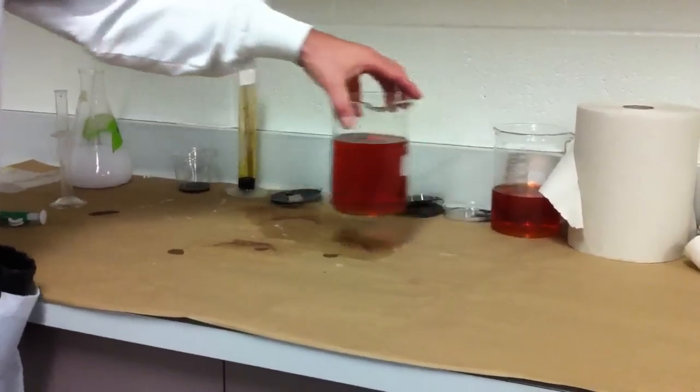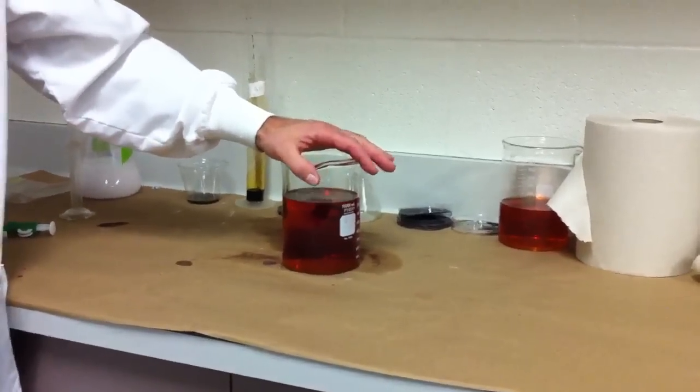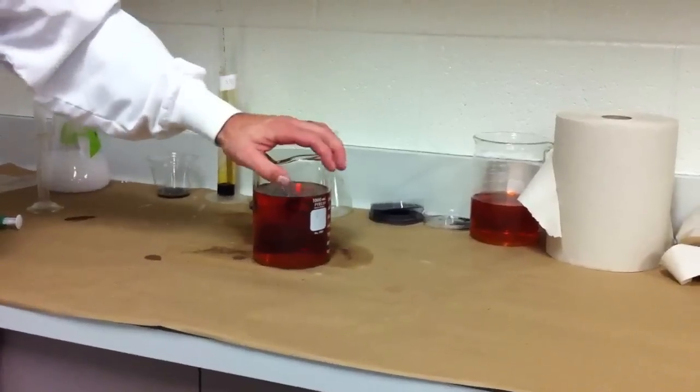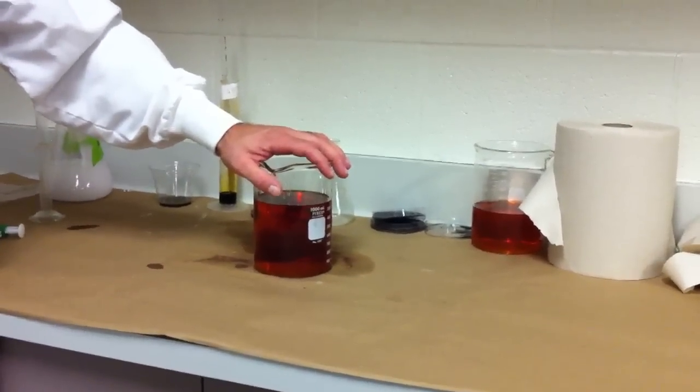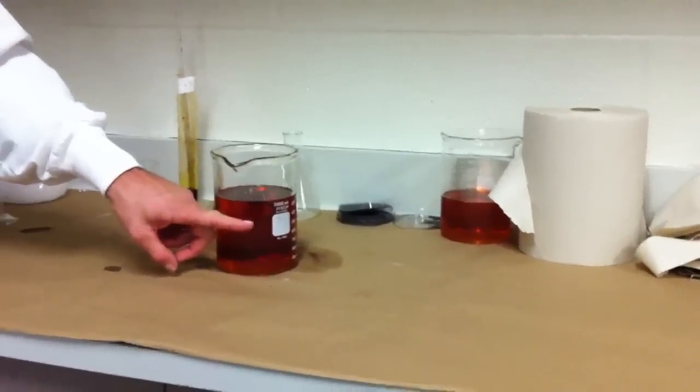Here's the actual experiment, though. That was just a demonstration. That's just to see that it's an indicator. This is my iodine diluted in some water. So you can see the starting color. How do we classify this?